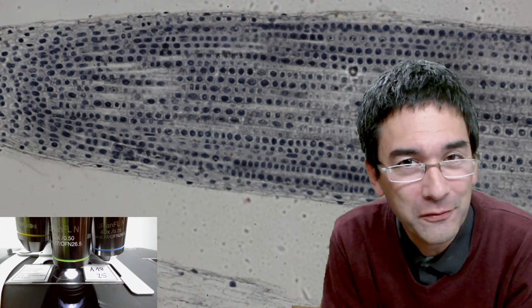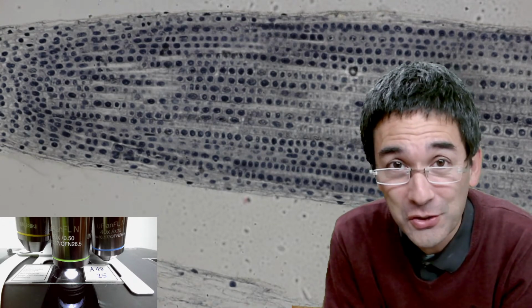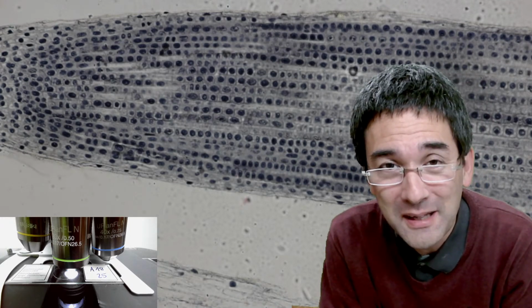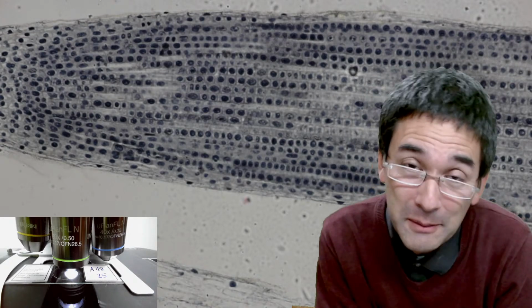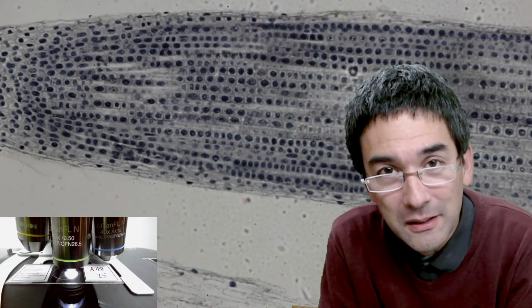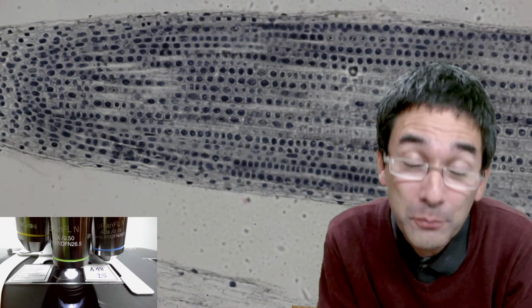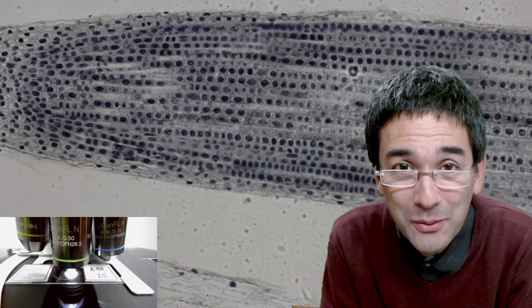I've been doing a lot of videos in the past about microscope hardware and also about different microscopy techniques. And I decided, well, today, why not place somewhat of an emphasis on a little bit of biology? So I hope it's also going to interest you. Today's video is going to be a little bit less practical than my previous videos were, or my previous live streams were. But I hope that they're still interesting for you.